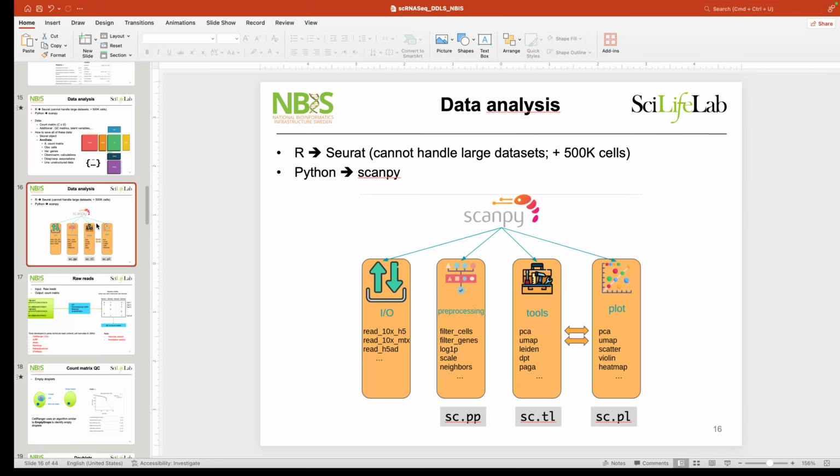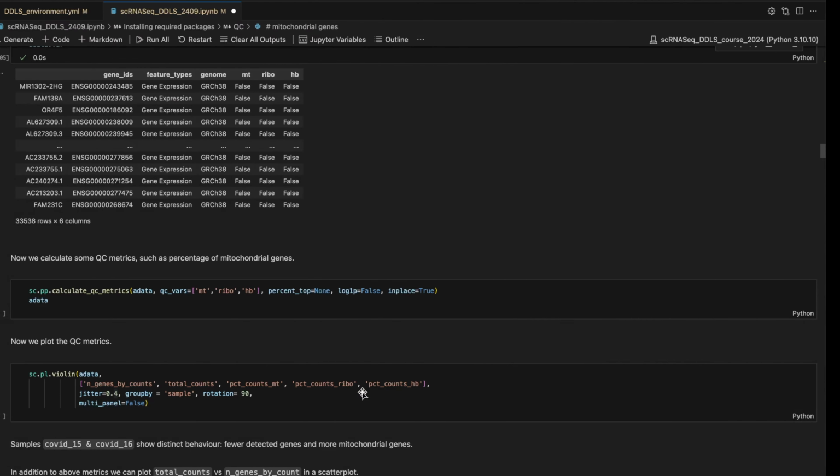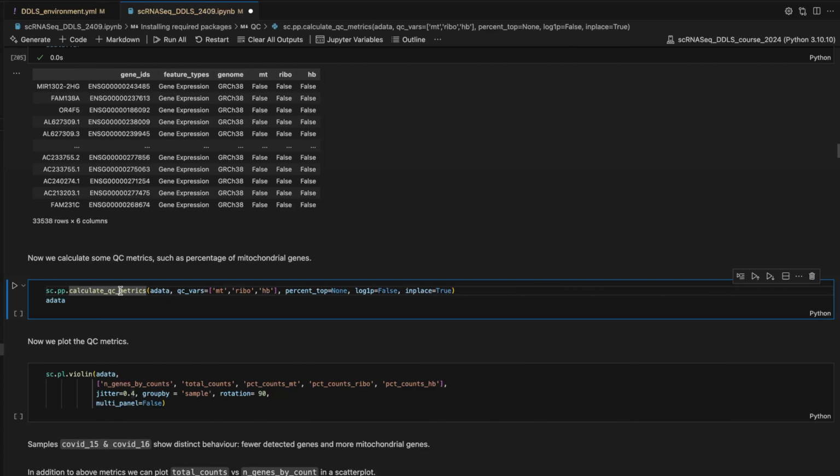Just an overview of what we discussed in the lecture: in Scanpy you have different modules. You read and write, which we talked about, and then we have three more modules: preprocessing, tools, and plotting. Now we are going to use the preprocessing functions in this stage. So what we do, we call calculate QC metrics. This is our data object, and the QC vars are MT, ribo, hemoglobin. And then we do not do any conversion whatsoever.